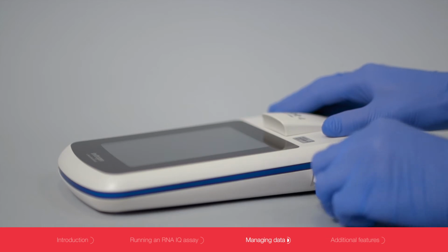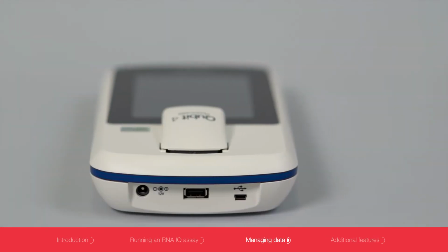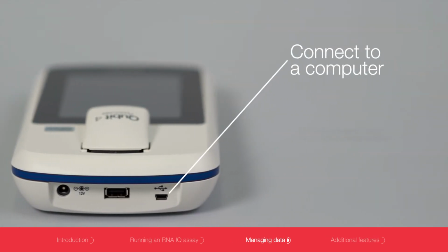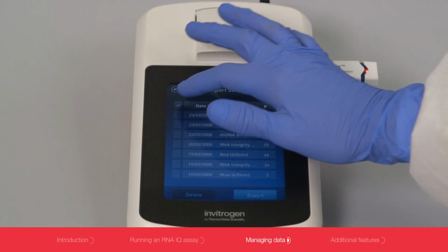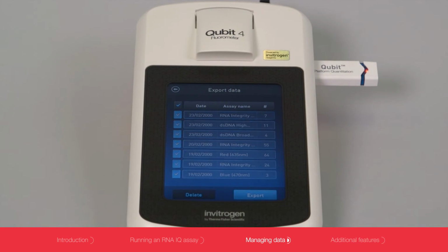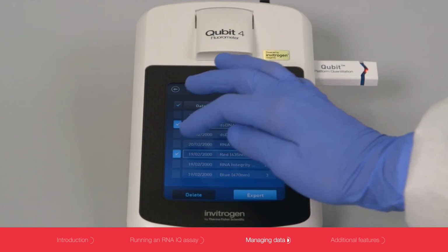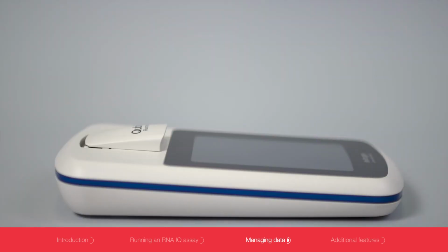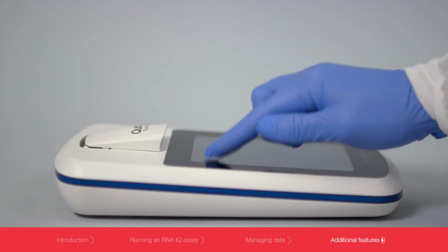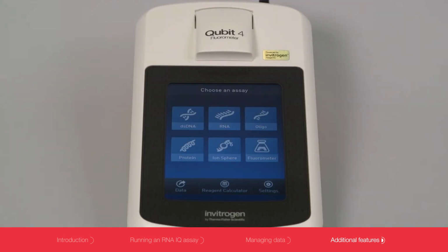Data can be exported via a USB thumb drive directly to a computer using a USB cable or Wi-Fi. After pressing Export, you can select all of the data or specific runs. The data are saved as a single CSV file. There are several additional features on the device that you can access from the home screen.